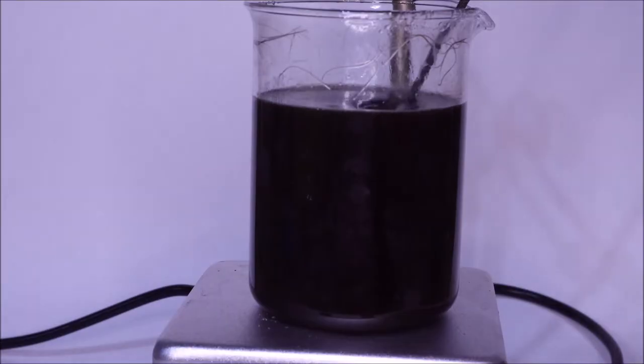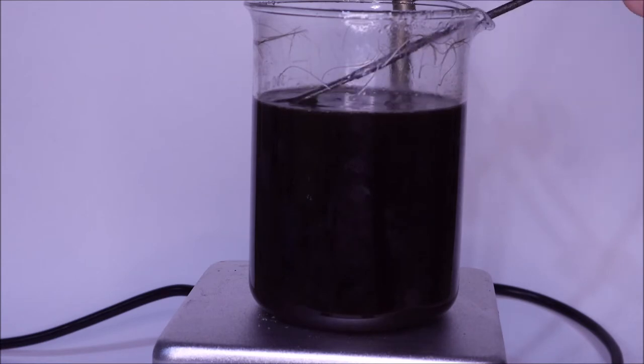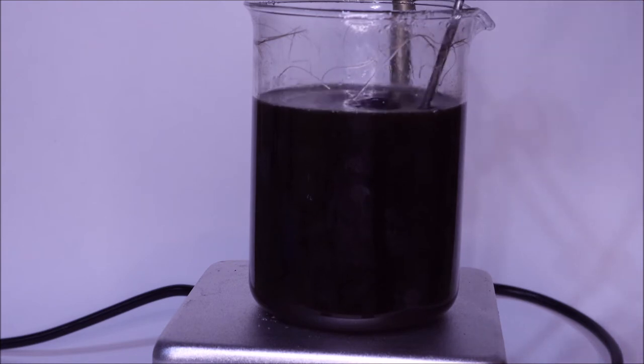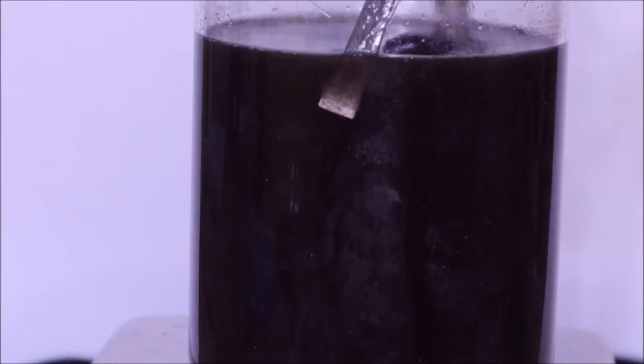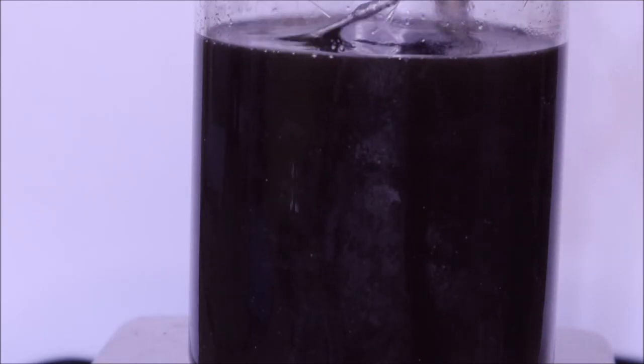I put the plastic cover on the container to prevent the water from boiling out of the container, not only to allow the concentration of acid to remain the same, but also to prevent the beaker from drying out since I'd be leaving it at a high temperature overnight. I really didn't want any disasters or to destroy the hair that I really only had one batch of.